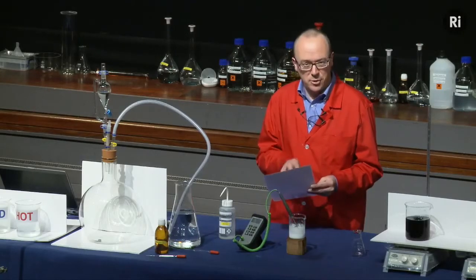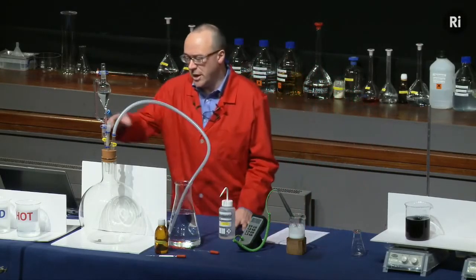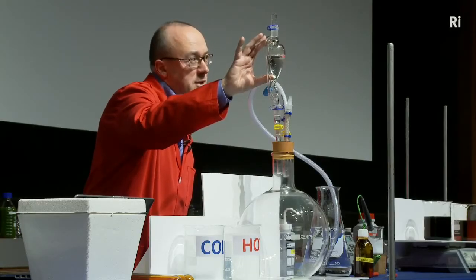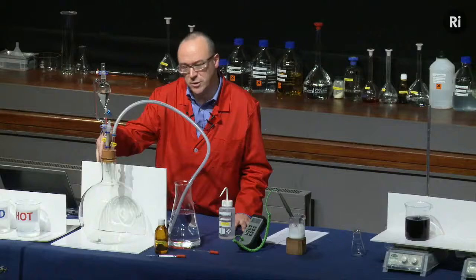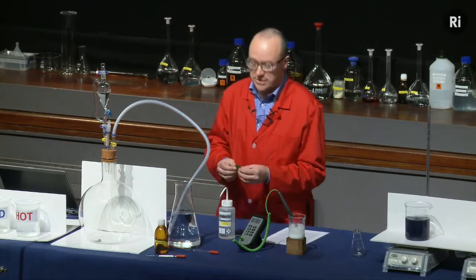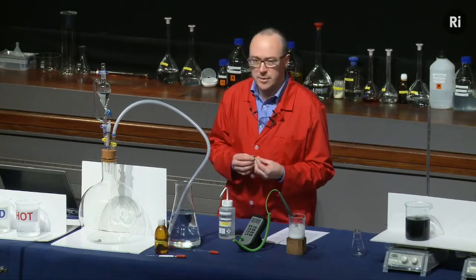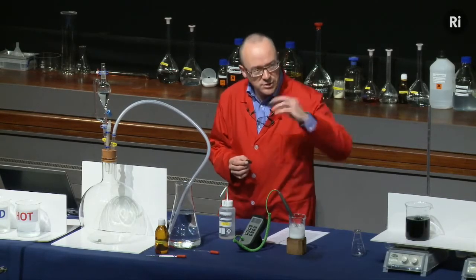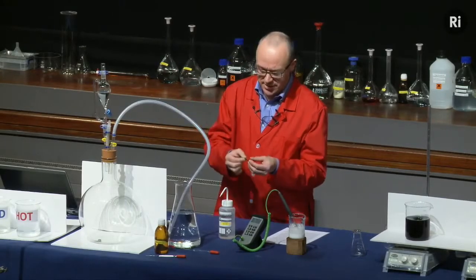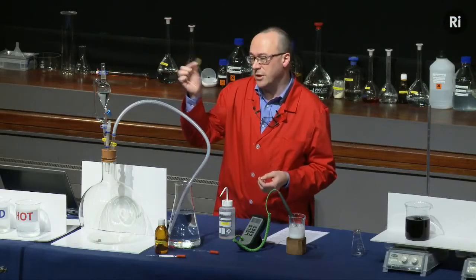And so when we get to the appropriate point in the story, I'm actually going to show you the reaction. And the reaction is going to happen in this flask. In this cylinder at the top, we have some nitric acid, and in the flask we have copper. Now the copper, for reasons you'll see in a moment, is in the form of a coin. Now we can't use a modern penny or two-penny piece because they're actually made of steel with just a thin coating of copper. So I've got an old-fashioned penny here. This was made in 1945. So this is actually made of solid copper.